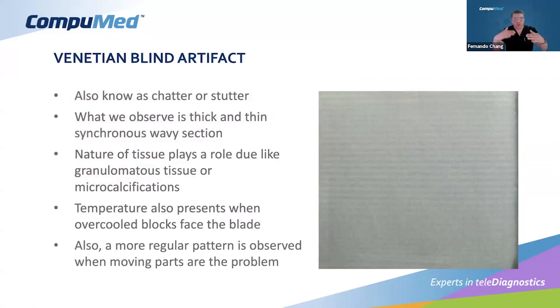So then we're going to look at another horizontal artifact that happens frequently. It's also known as chatter or stutter, because you can see these synchronous, repetitive, wavy sections on the slide that happen quite frequently. And like I mentioned before, sometimes it happens due to the nature of the tissue, like when we have microcalcifications. It's more uniform because these microcalcifications, these granulomatous characteristics of the tissue, are global. It's not focal in one area, but more like a global thing on the entire tissue. So that's why we can see this pattern of Venetian blind artifact, chatter, in this more repetitive, more synchronous way.